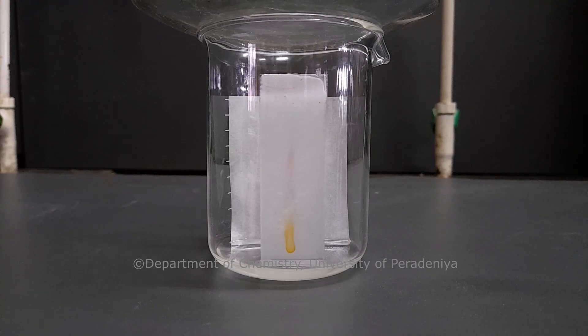Therefore, the TLC plate is removed once the solvent front has reached the marked line.